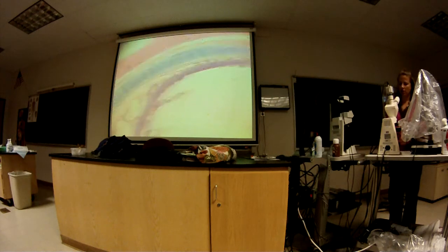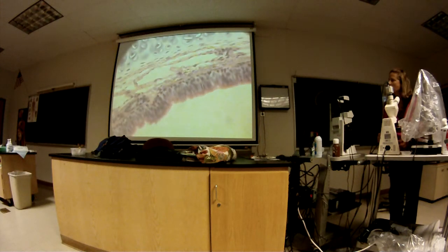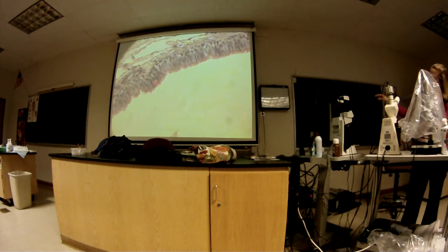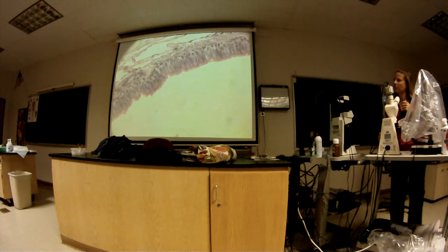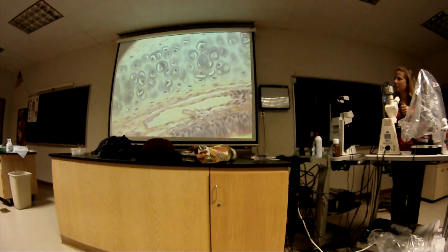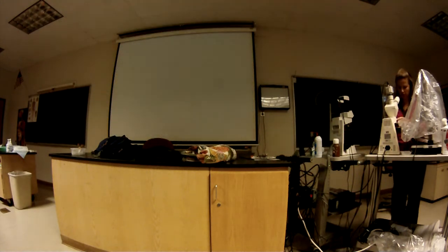Okay, so here's your pseudostratified, ciliated, columnar epithelium. And let's see if we can see. So there it is. That looks nice. You can see the cilia. So this is where it ends here. So basal lamina would be here. This is a mucous membrane, the epithelium and the underlying areolar tissue. Mucous membrane all along the respiratory tract. Here's your, what kind of tissue is that? Hyaline. Hyaline cartilage, yeah. So some good looking hyaline cartilage.